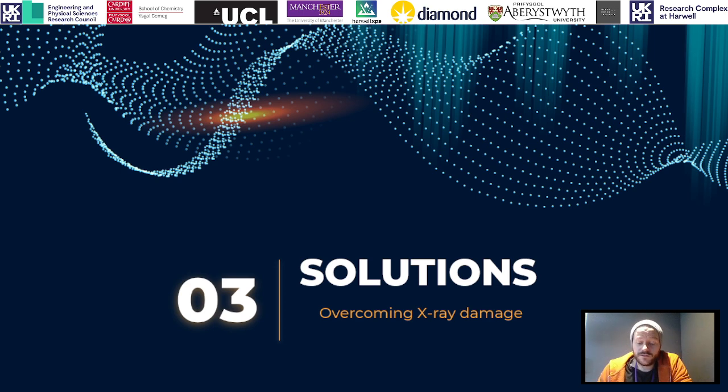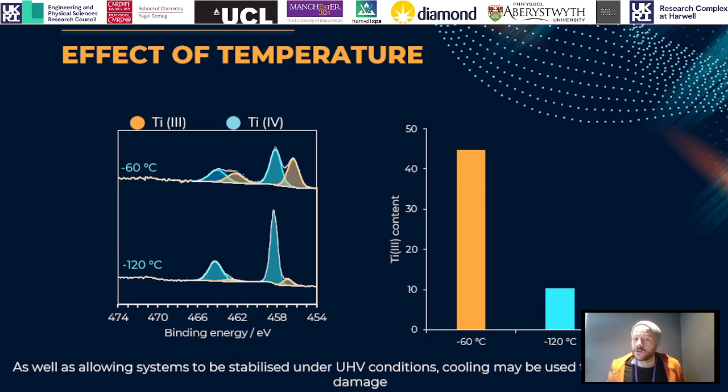So what kind of solutions have we got to overcoming X-ray damage? Well, firstly, we've already spoken a little bit about temperature and how some samples we need to cool to get any data at all. But the effect of temperature on, for example here, our titanium butoxide system, is that the colder we get, the more we can actually prevent this reduction from happening. So we've got two spectra here, one taken at minus 60 degrees C, one at minus 120 degrees C. And you can see a drastic difference in terms of the amount of titanium 3+ that's been produced by this X-ray damage. And if we look at the quantification on the right, you can see that after a short period of measurement, we've got nearly 50% titanium 3+ at minus 60 degrees, whereas when we get down to minus 120 degrees, we've reduced this down to less than 10%.